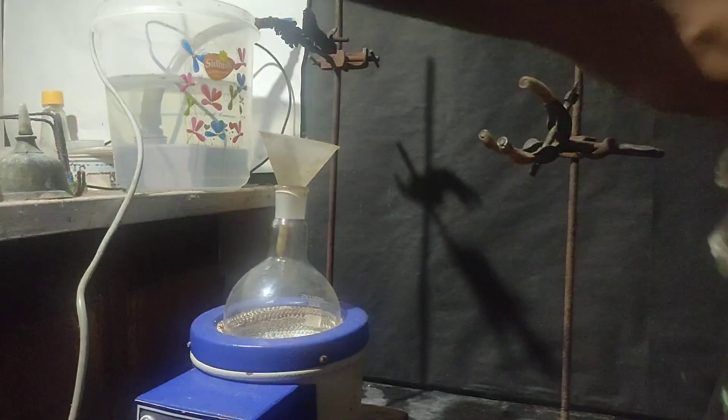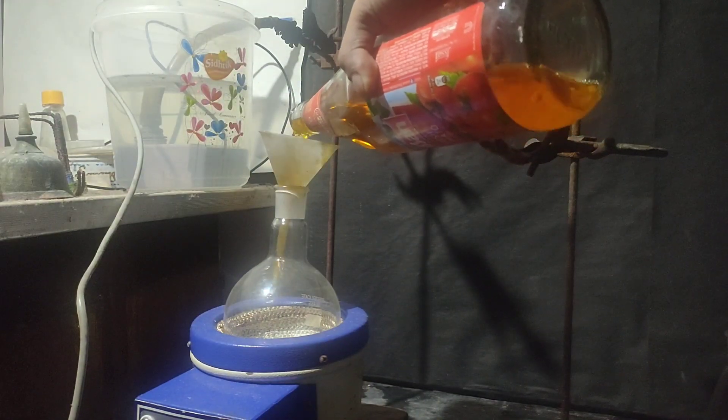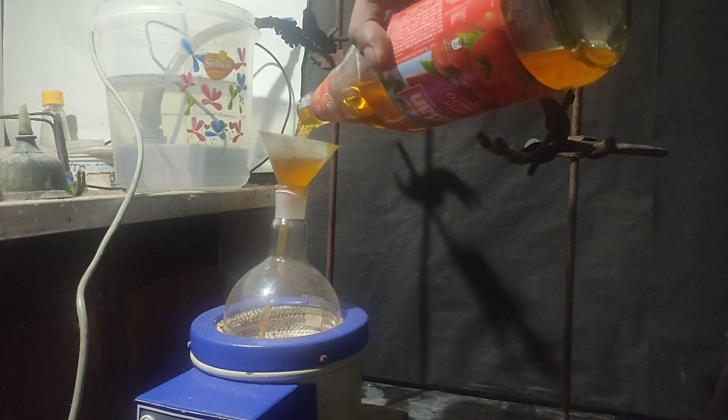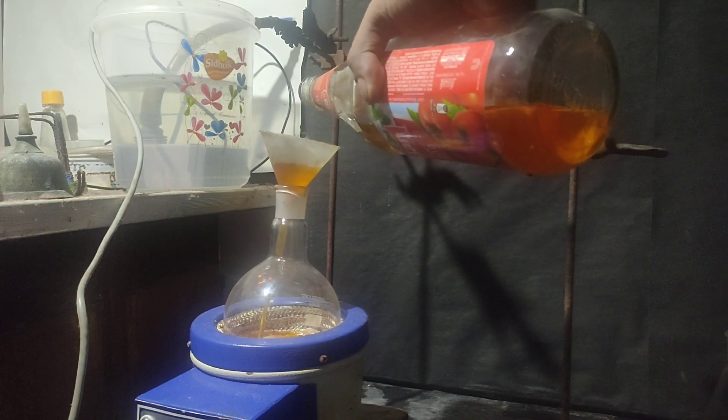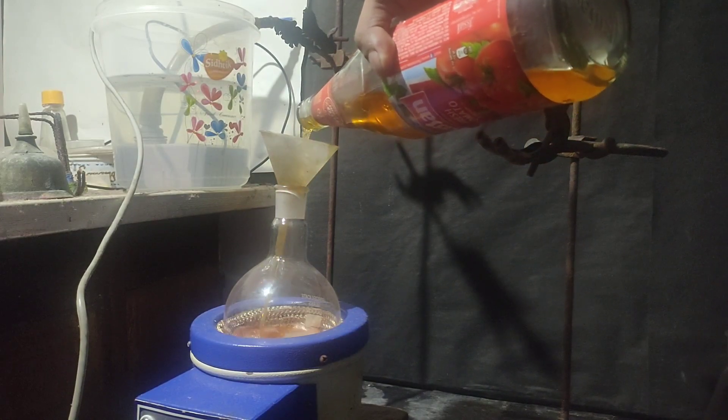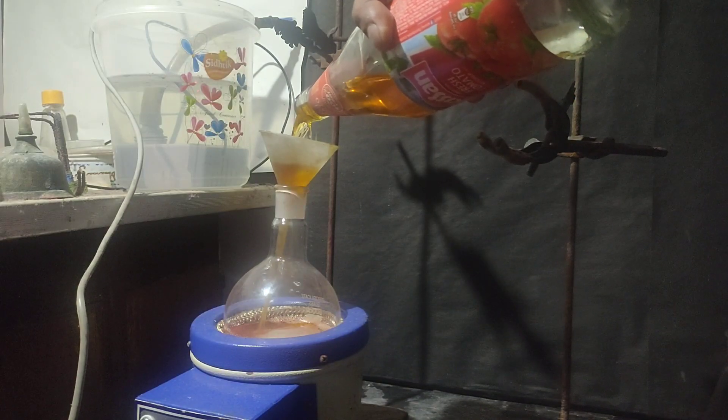In this video, I will be doing fractional distillation of petrol to obtain solvents such as pentane, hexane, heptane and toluene.